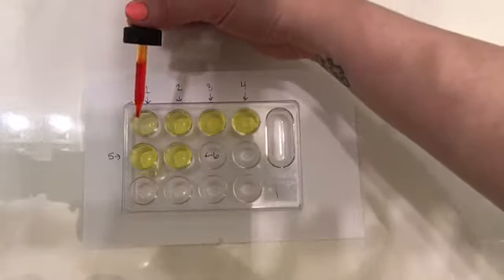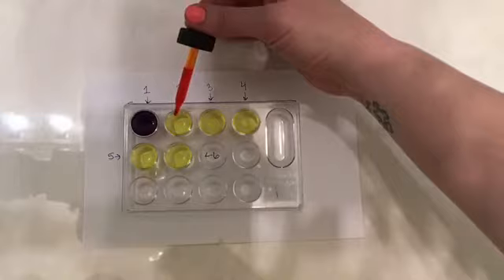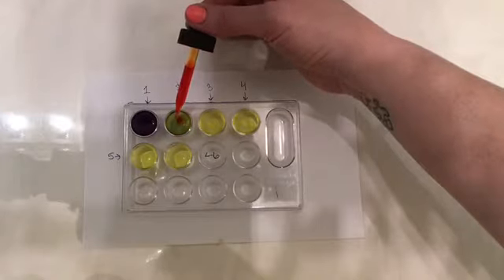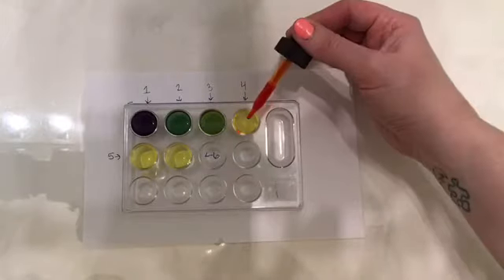So let's start testing. Okay let's see. Let's see here. Whoa. Whoa. Okay. Suspect number two. Hmm. Green. Interesting. Suspect number three. Green again. Hmm. Suspect number four.